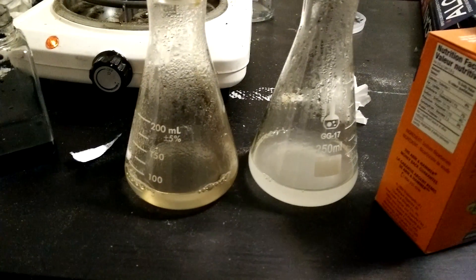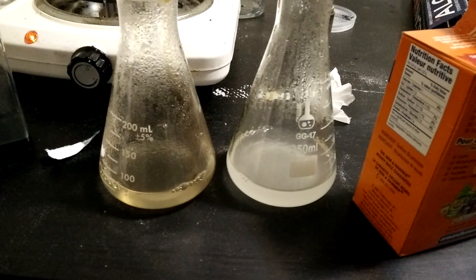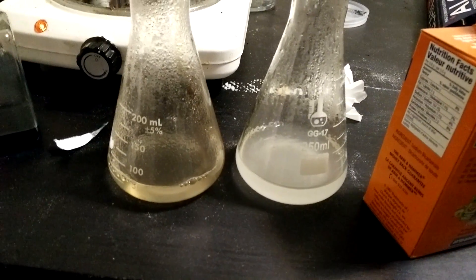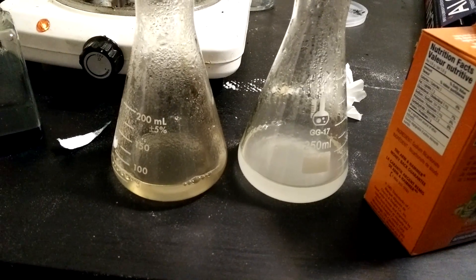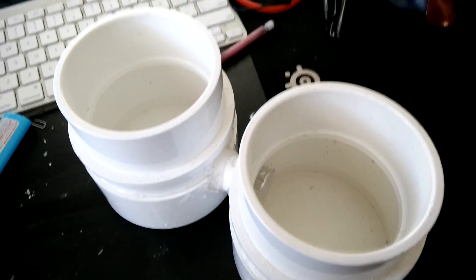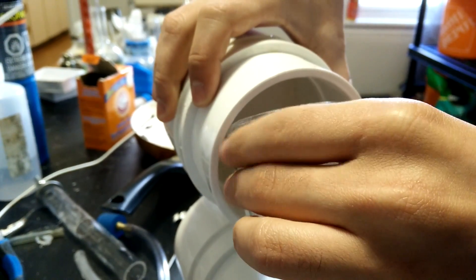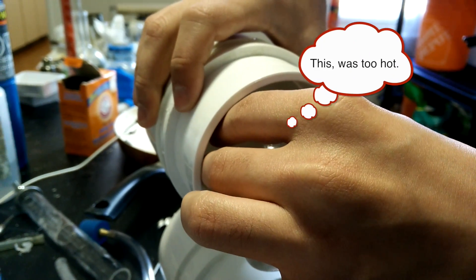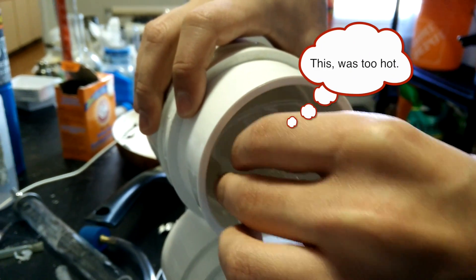Once you've got your hot gel solution mix in either baking soda or salt. The salt will lead to a little bit of chlorine coming off the cell but it's pretty minor - you only need to add enough to make the gel more conductive at the beginning. I used a piece of metallic tape to cover one end of the tube and then turned the cell on its side. Let the solution cool until it's a minute or two from going solid but is still runny, then quickly fill the tube and allow it to cool completely and harden.